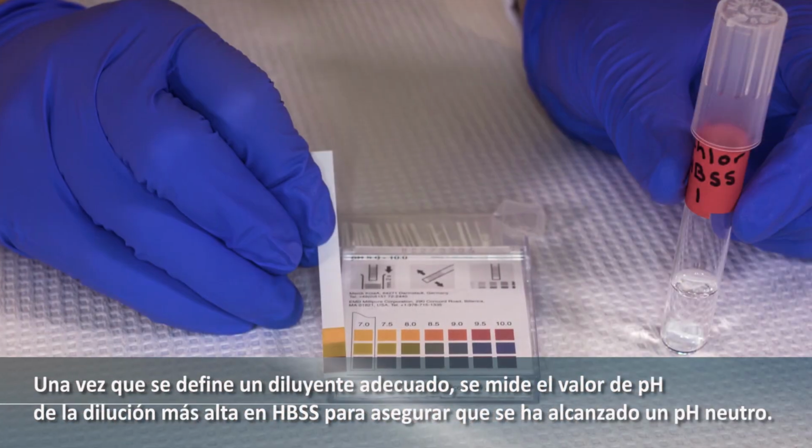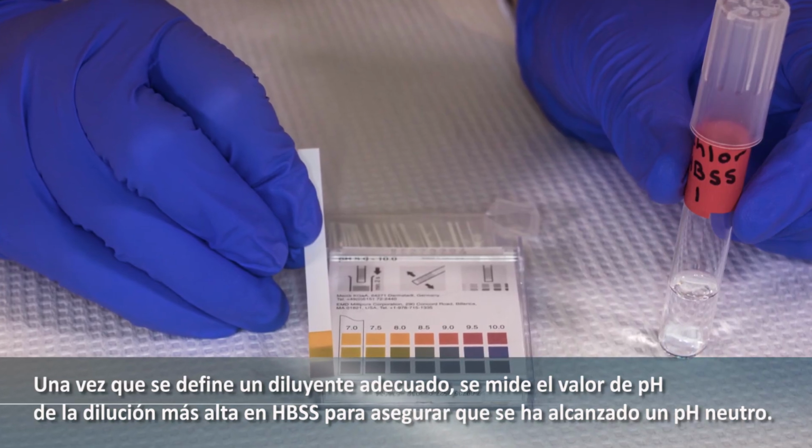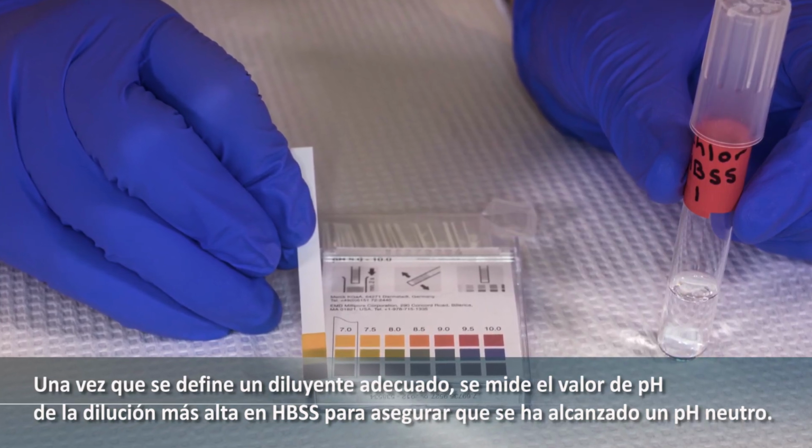Once a suitable solvent is determined, the pH value of the highest dilution in HBSS is measured to ensure that a neutral pH has been achieved.